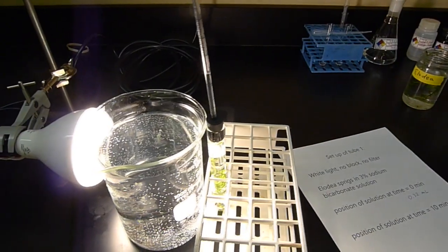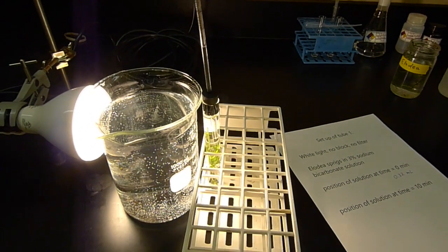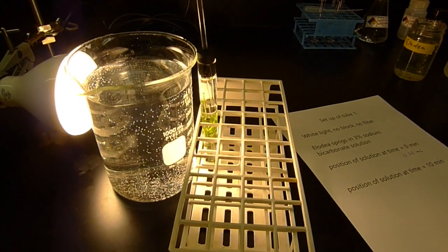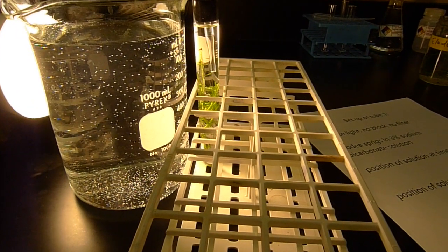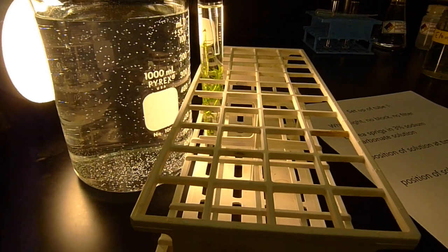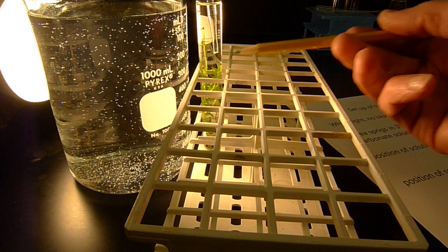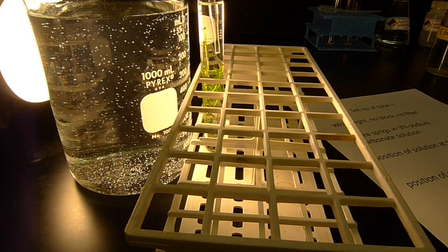I'm not sure if I can capture this on camera. This is going to be a difficult one. But I can actually see bubbles coming up in that test tube. So let me see if I can show you that, just so I can be convincing that there's actually a bubble coming up here. Not right. There was one that went right then. I'll wait until one more comes up. But it's coming up. They're coming up off the tips of these Elodea. Occasionally there are bubbles coming up here. Let me see if I can.